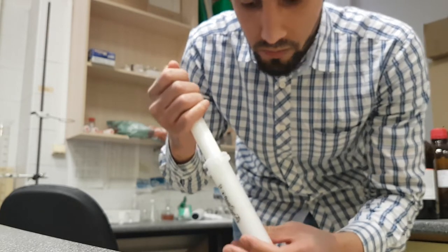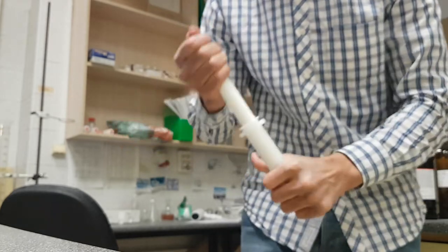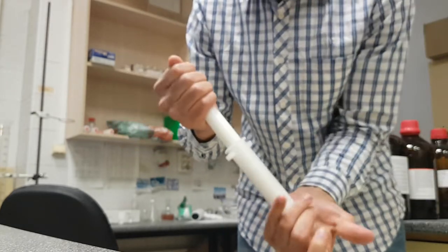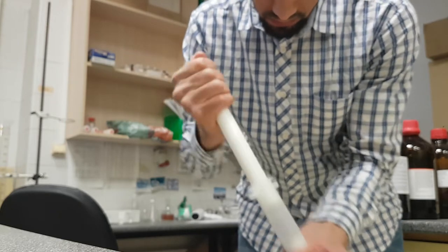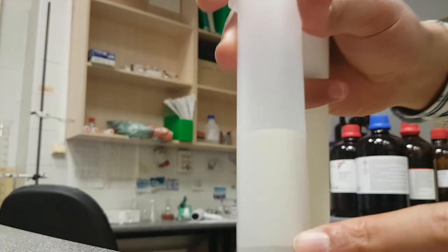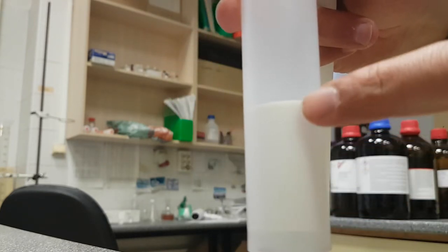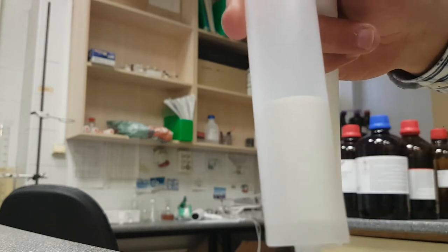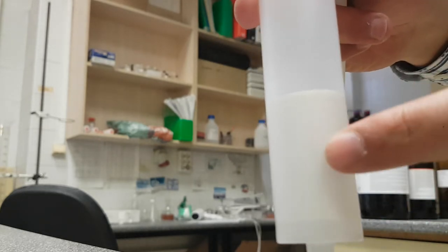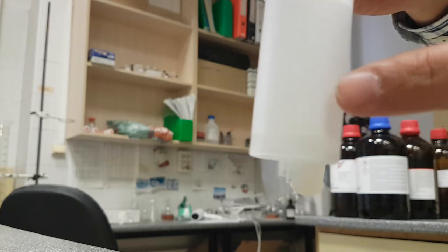Then I need to strike. I need to turn it to be uniform. You see here, there is no porous between the silica. It needs to be compact.